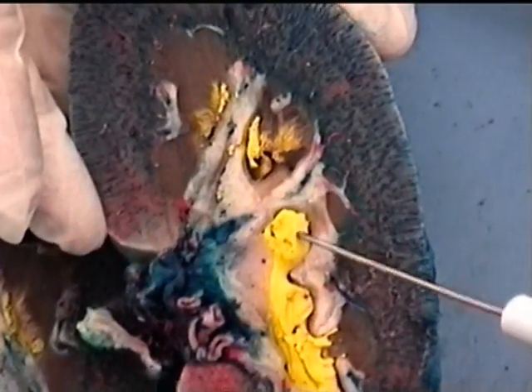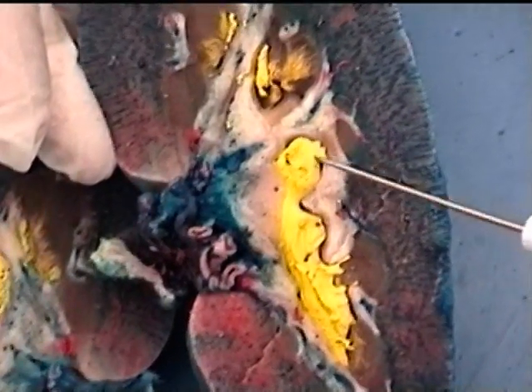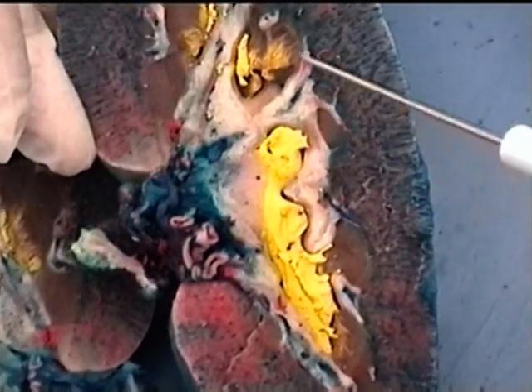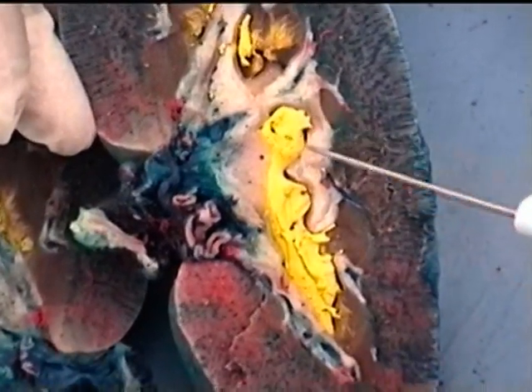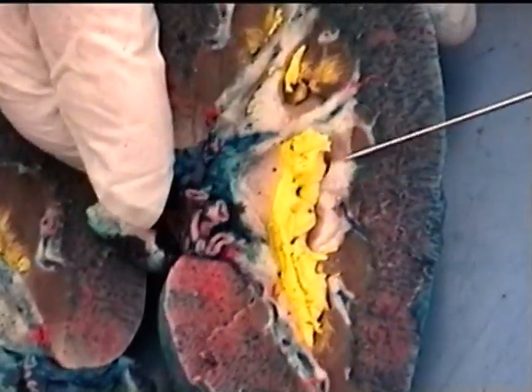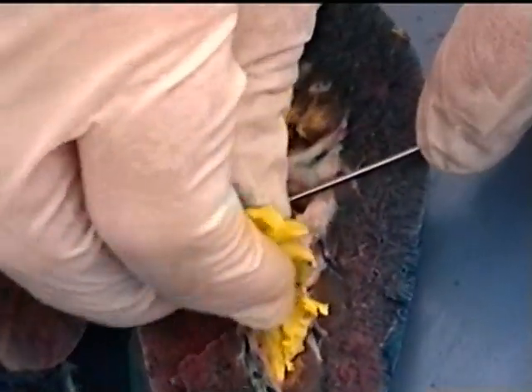So what's kind of cool is this and this, where we see this round and the round here, these were minor calyces that were all arising from a renal pyramid, and then when minor calyces come together they form major calyx. So that's what we're seeing in this area here. Maybe we can pull this out and actually see that pattern, which is really kind of cool to see with the latex.